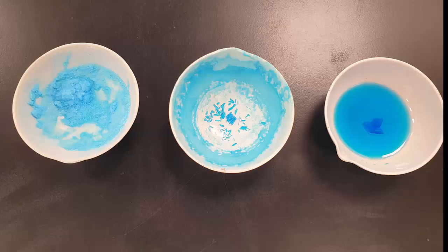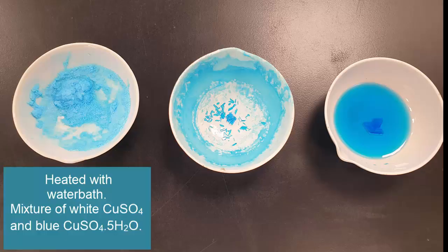But if you look at the results here, you'll find that the first one, that was the one that was heated up with the textbook method. And you can see this, it's even a little bit whitish. Well, if it's white powder, it is actually copper sulfate, but the blue is what you normally end up with. And so it's usually copper with 5 waters attached.